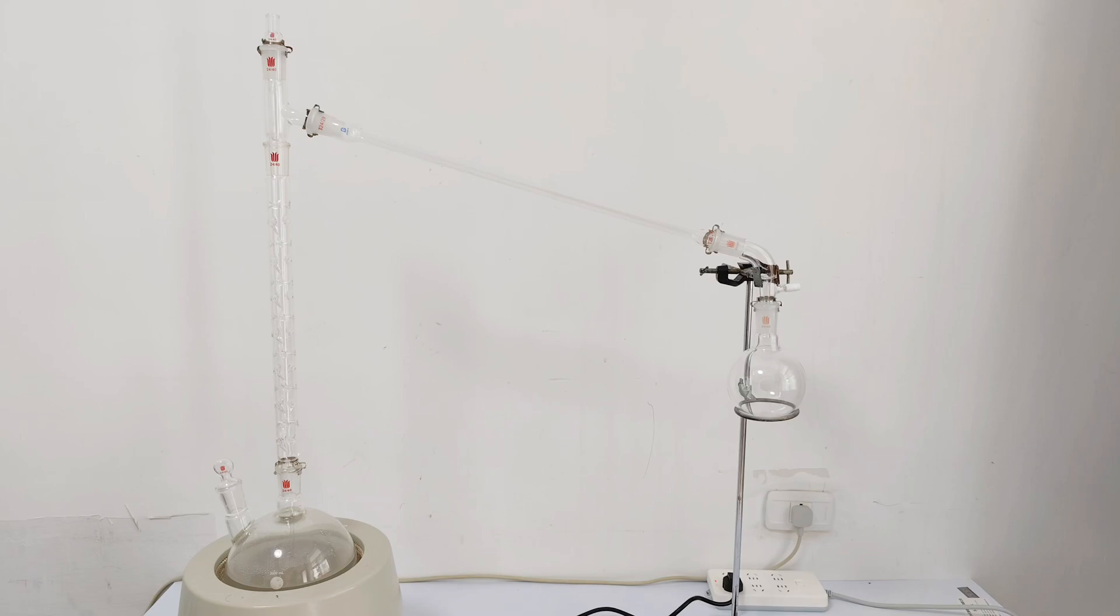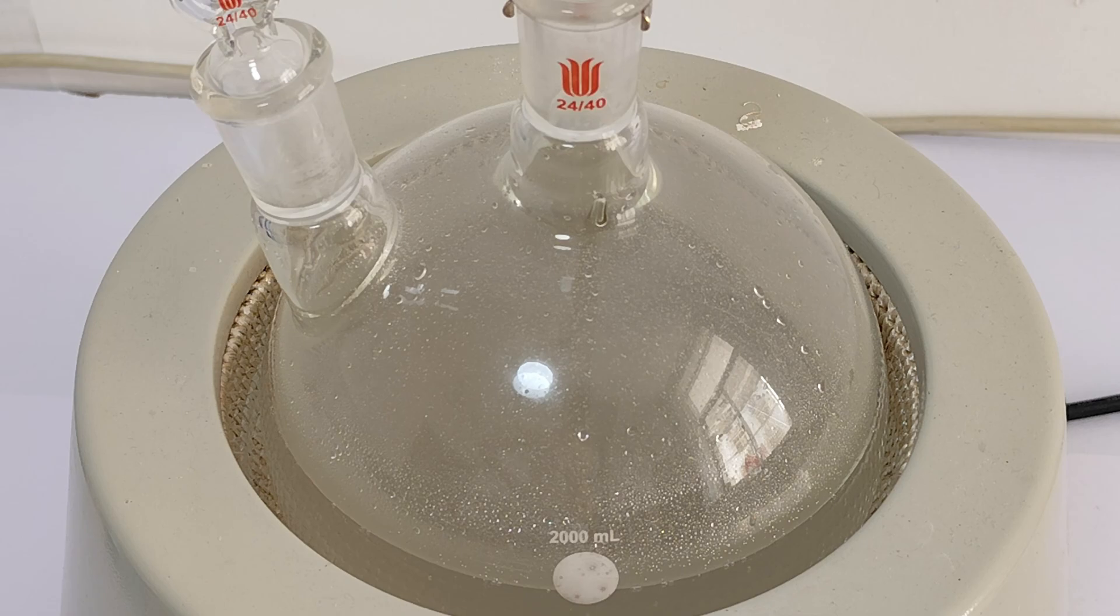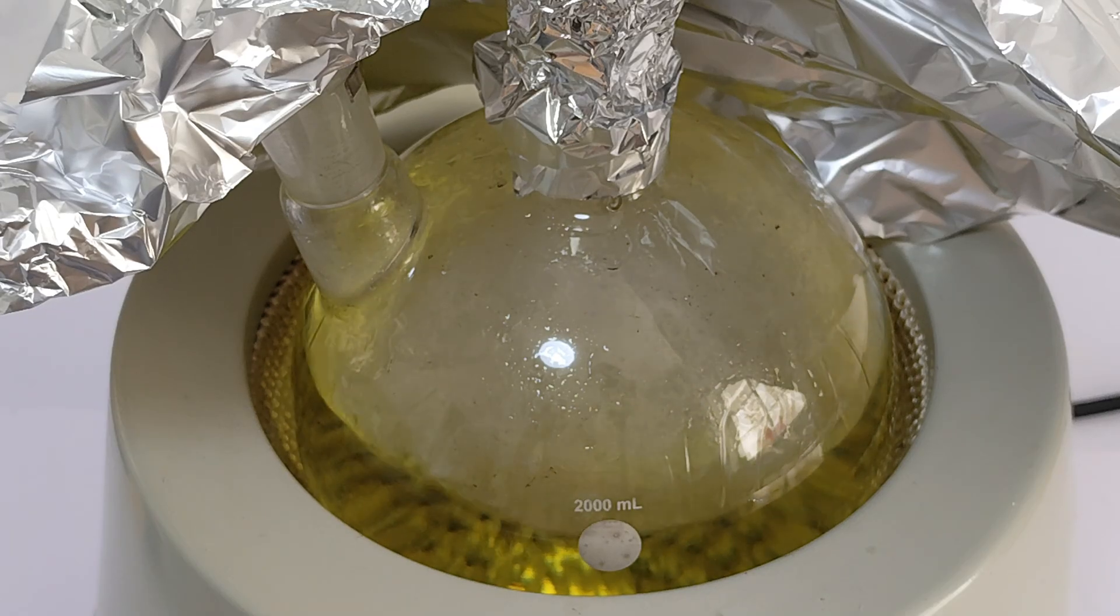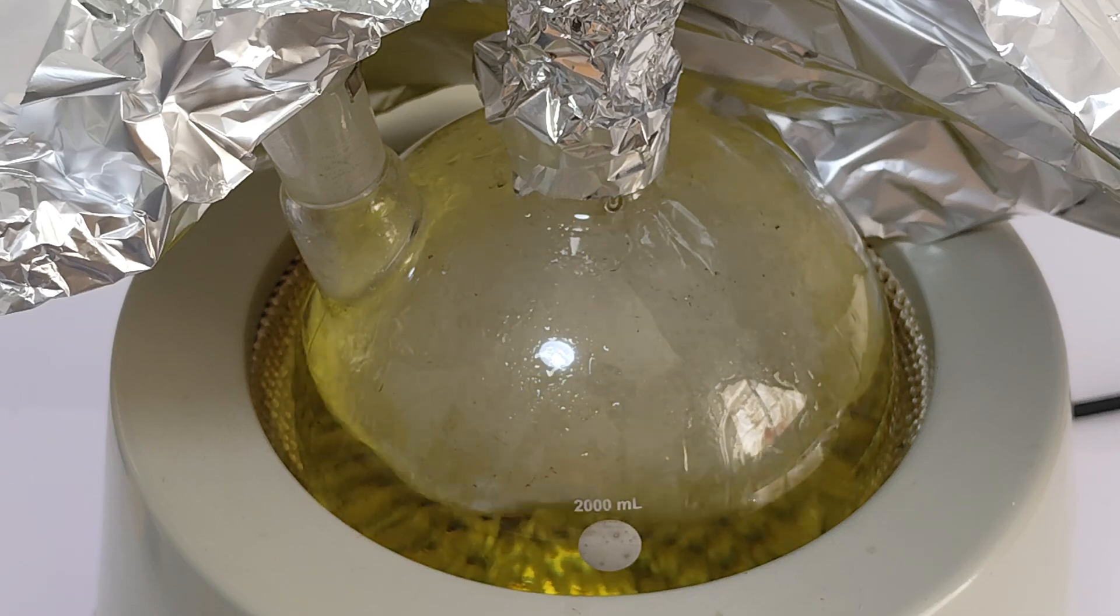As all the things are ready, I build a setup and turn on the heater. A few minutes later, the acid started to boil and bubbling smoothly. Also, it became slightly yellow.